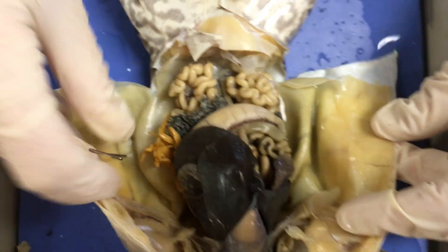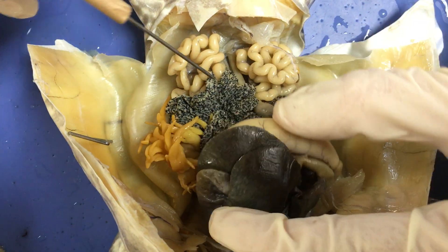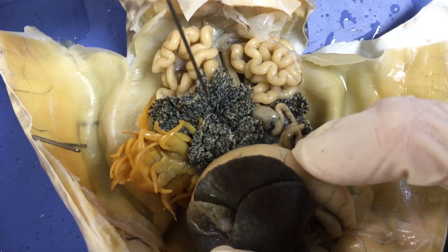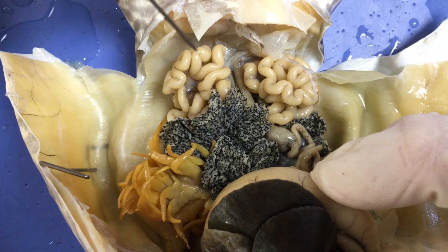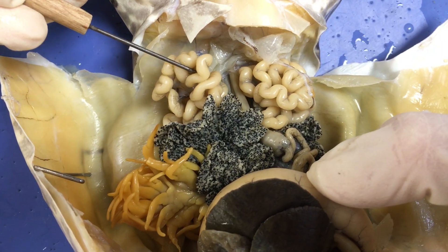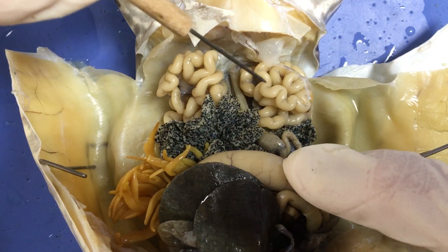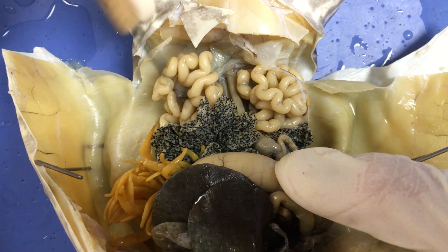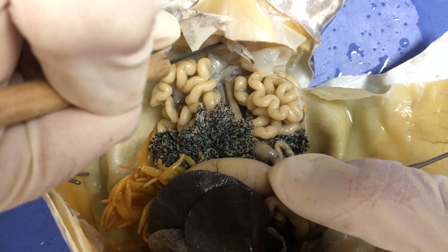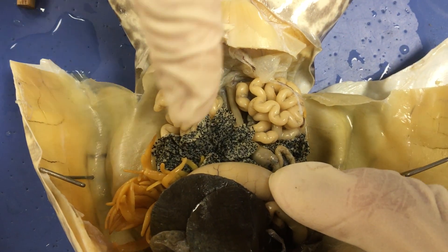Over here is our female, who still has all of her internal organs. You wouldn't see testes. Instead, you see this kind of black and white, salt and pepper structure — these are all the individual eggs. They aren't large enough and mature enough to be released yet; they'll get much larger before she's ready to lay eggs. You will also see this structure, not to be confused with the small intestine — we've got small intestine up here attached to the stomach. This structure down here that looks very similar is the oviducts. All of these eggs, once large enough and mature enough to be released, will travel into the oviducts, which connect at the cloaca, because that's where the release of all reproductive products occurs.